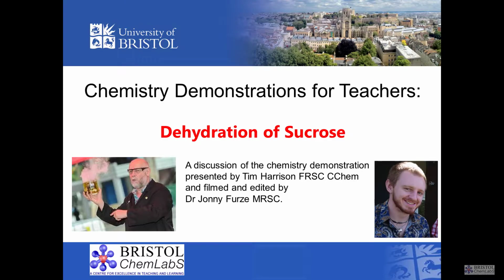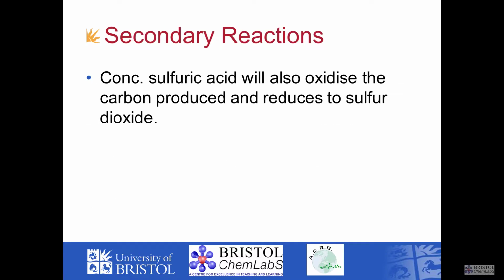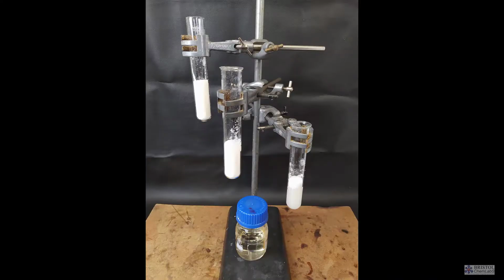This is a demonstration of the dehydrating properties of concentrated sulfuric acid on its reaction with sugar. And here we're using normal table sugar, so sucrose. In the setup, we've shown three boiling tubes partially filled with sucrose that we have either wet or left dry. As you'll see from the experiment, using dampened sugar is the best approach.